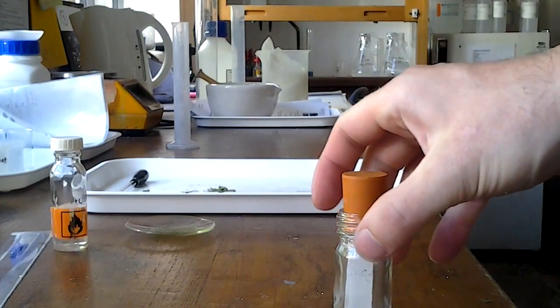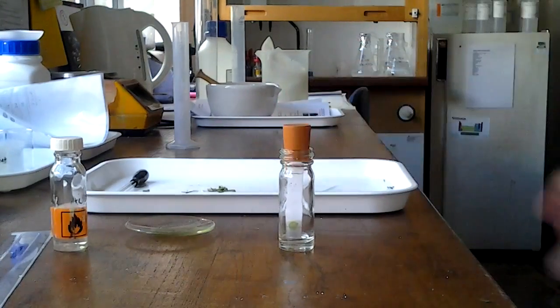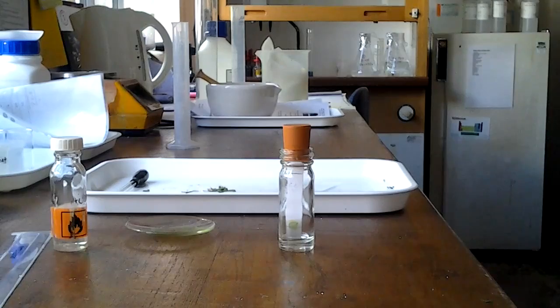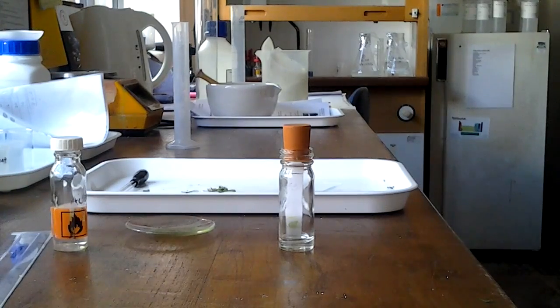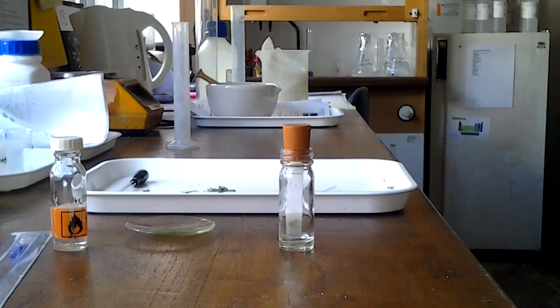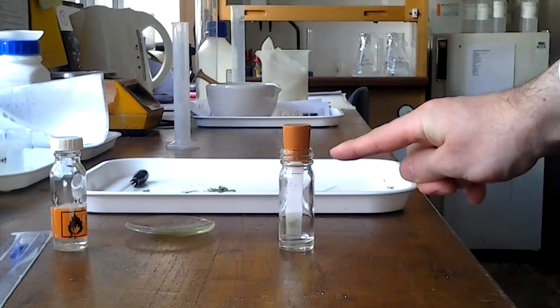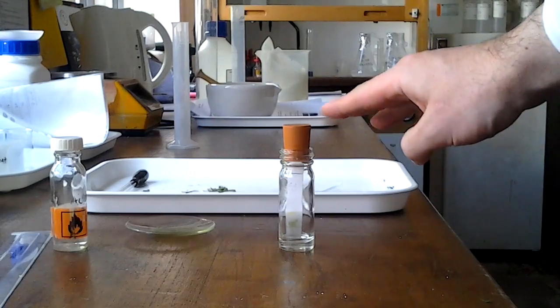I'm moving it very carefully. I'm trying not to pick it up and shake it around too much because I'll end up with an uneven solvent front, and I may even end up washing my pigments out at the bottom there. But we're going to leave that. But that doesn't mean you can just go have a snooze for a few minutes. You actually have to keep your eyes on it because you might be able to see that solvent front marching up the thin layer. You need to keep your eye on it. The second that solvent front reaches the line at the very top, that's when you have to take out your thin layer and end the process. If you don't catch it in time, the solvent front will keep on moving all the way up, it'll even go beyond the top of your thin layer. All of your pigments will end up squished up at the top, and you won't be able to see them as separated out.